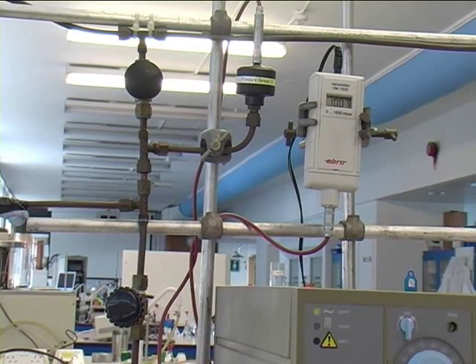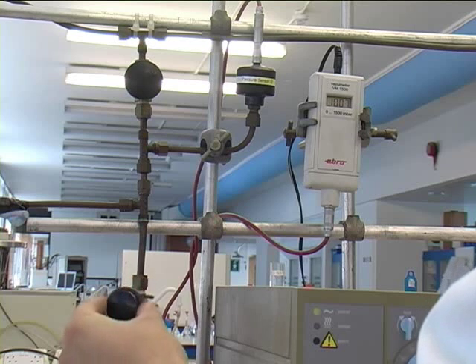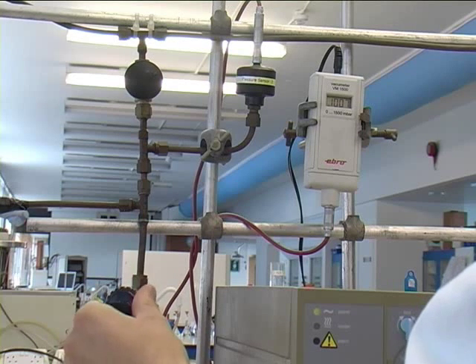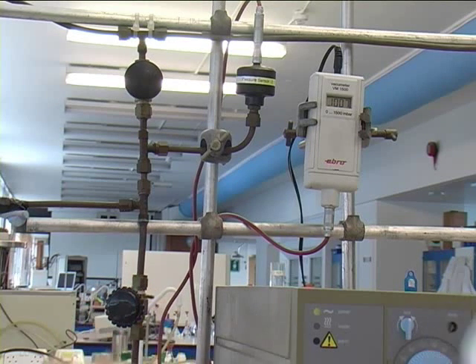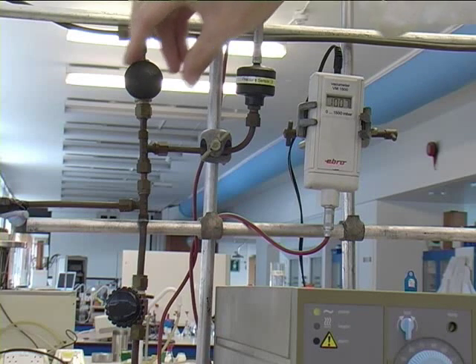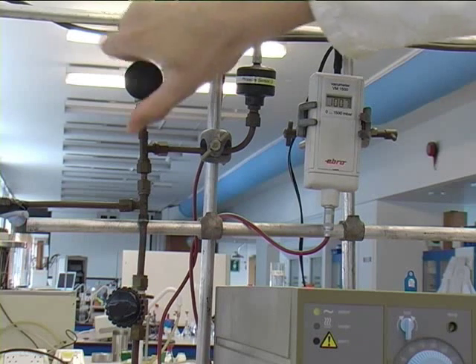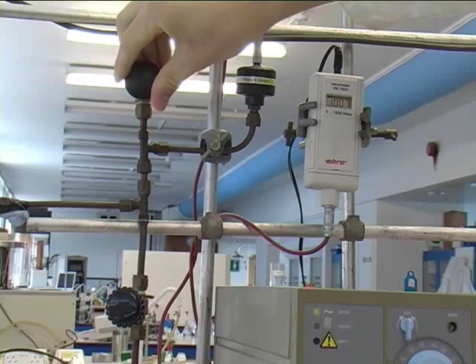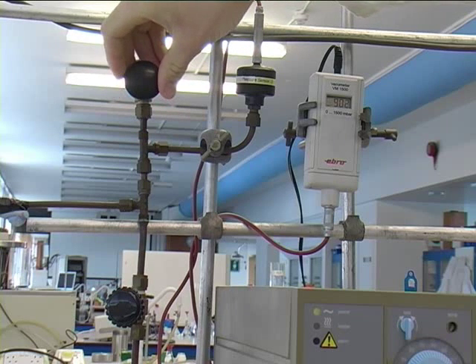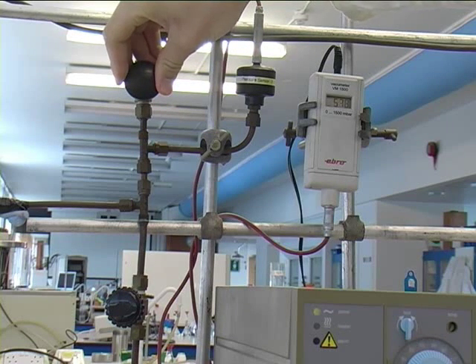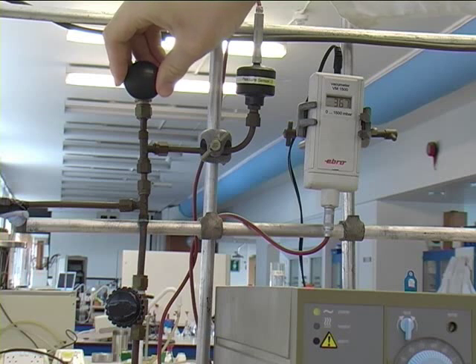To the side of the apparatus are two valves. The top valve is connected to a vacuum line, and the bottom valve is open to air. The system is evacuated to remove any air that may remain in the capillary, and it is left pumping out for approximately two minutes before the practical is started.